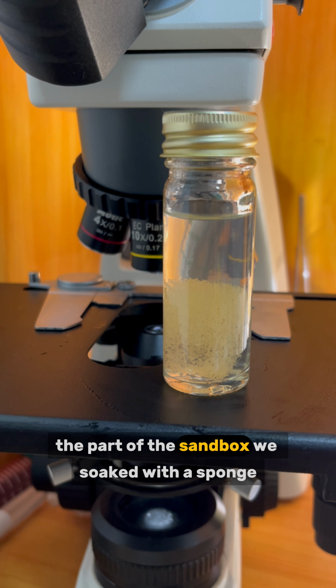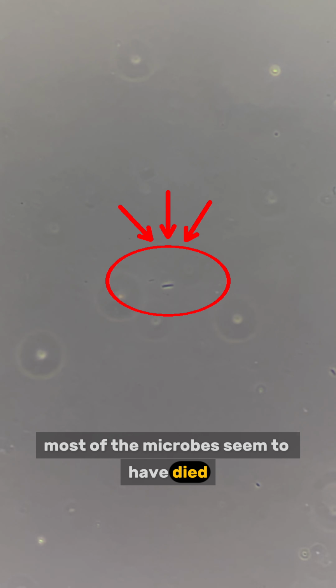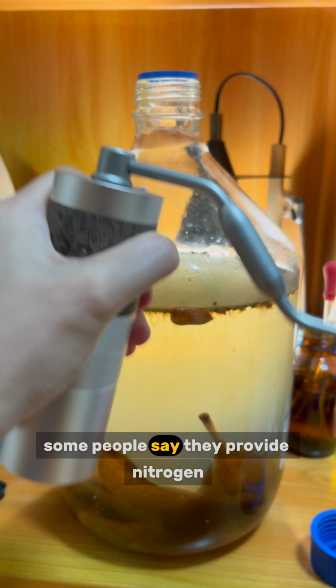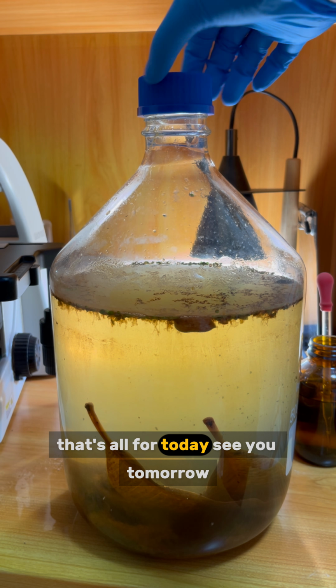Remember the part of the sandbox we soaked with a sponge? Let's check on that. Once again, most of the microbes seem to have died. Only a few bacteria are slowly swimming. Today, we're adding coffee grinds. Some people say they provide nitrogen. Let's try that, along with a bit of caffeine. That's all for today. See you tomorrow.